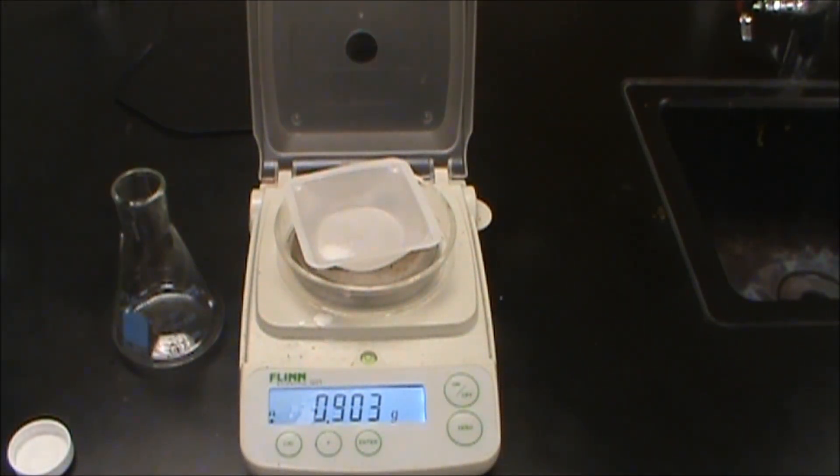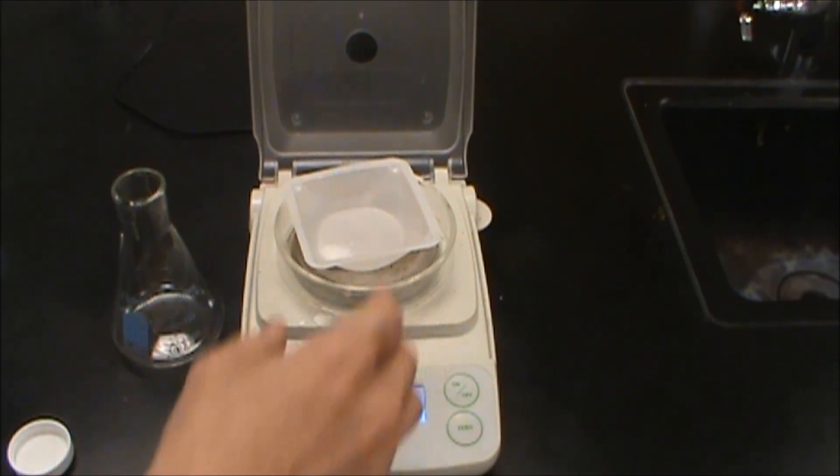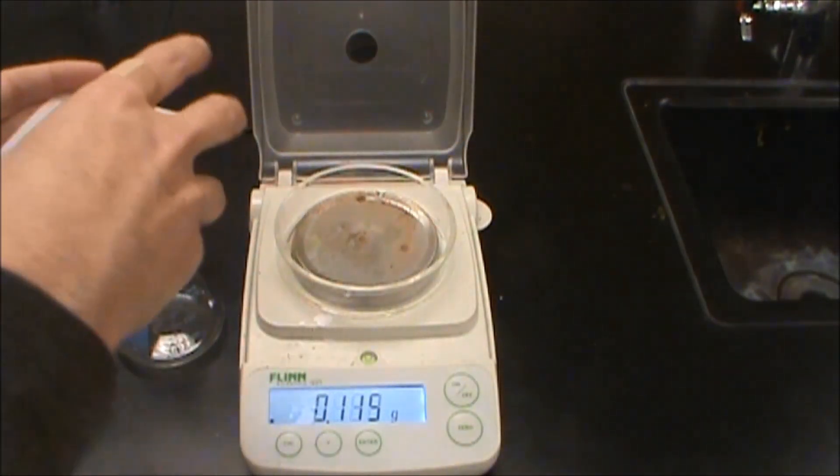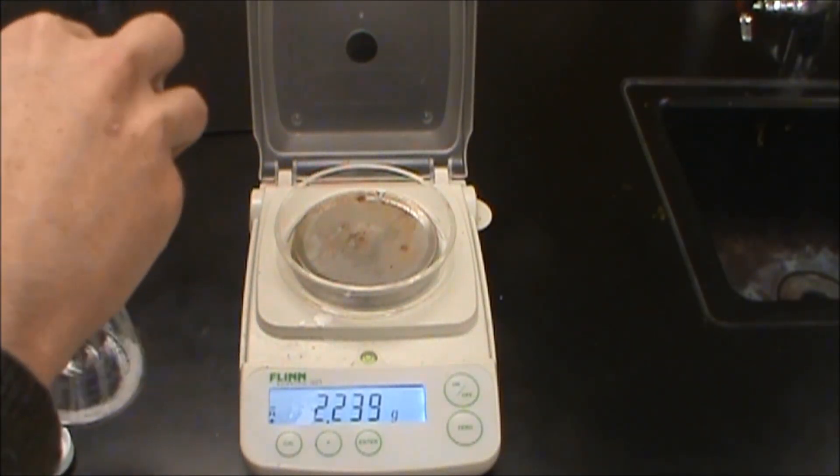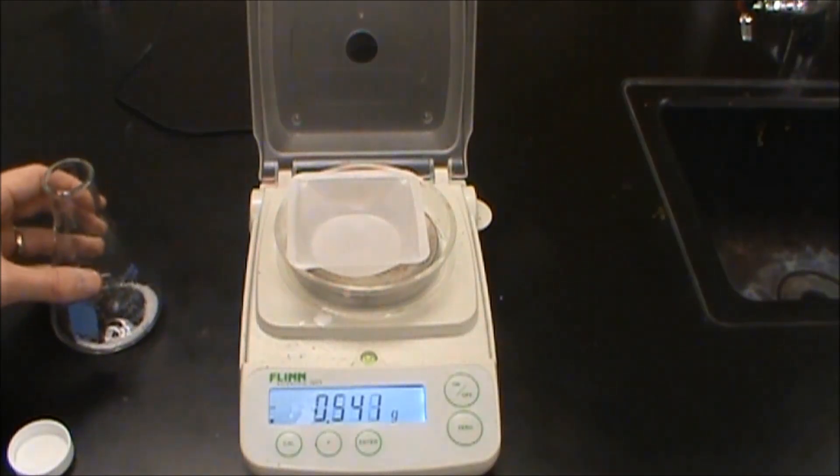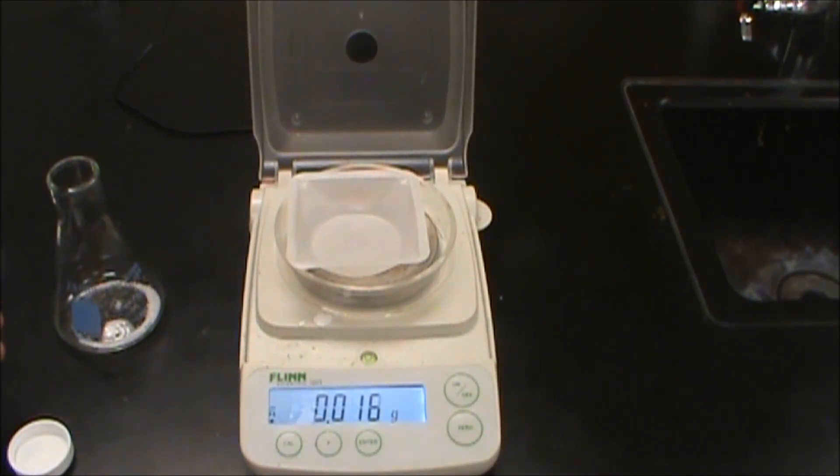So we went a little over. It's okay. So 0.903 compared to this. So we're looking at 0.919.